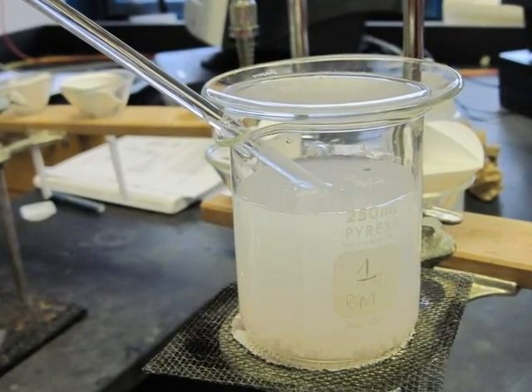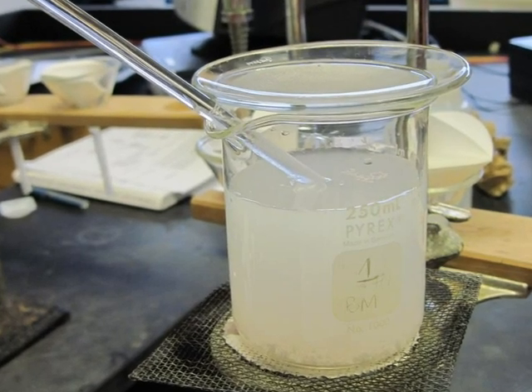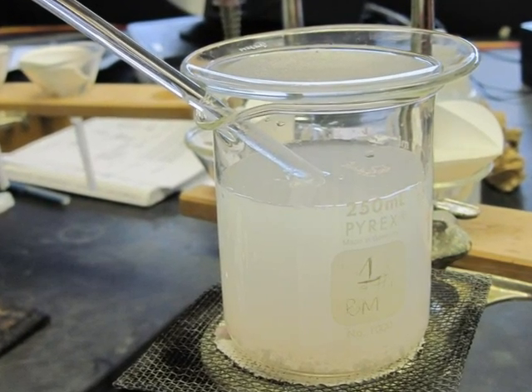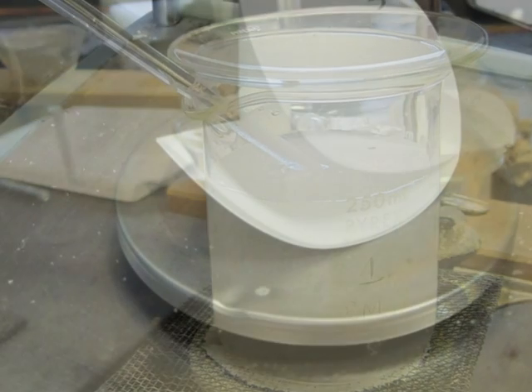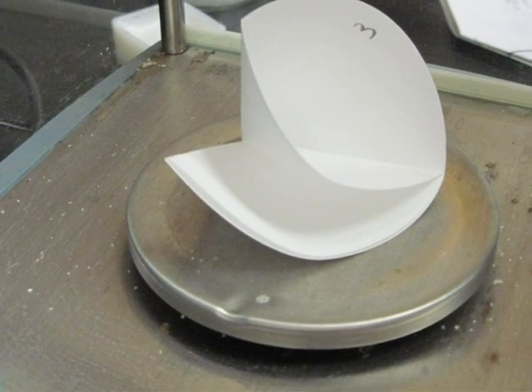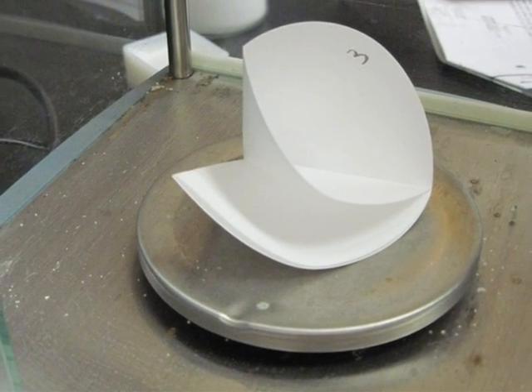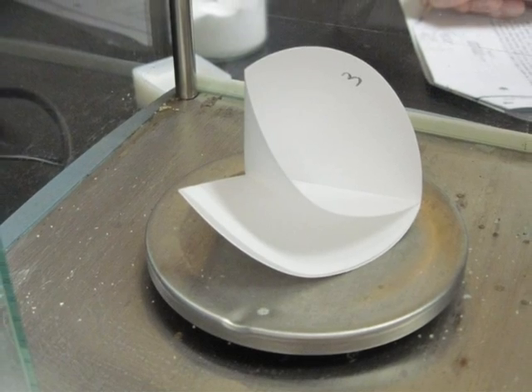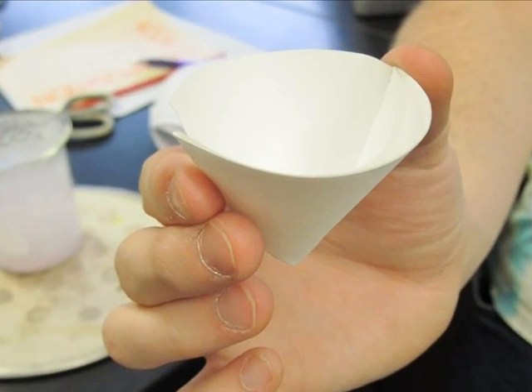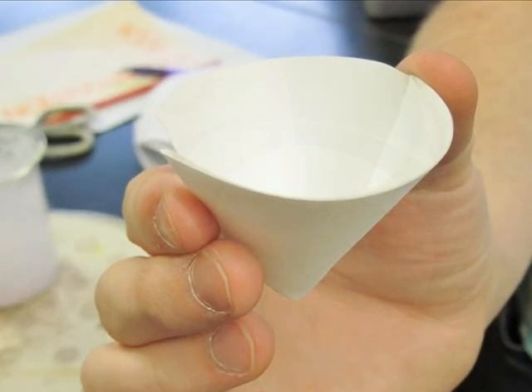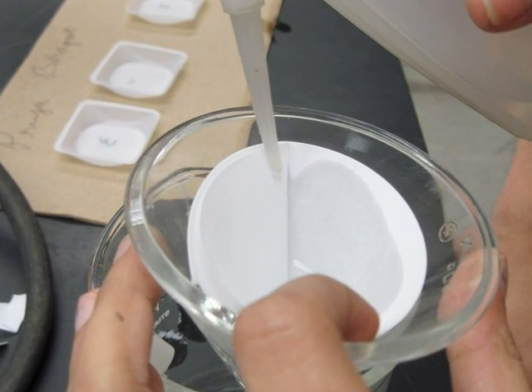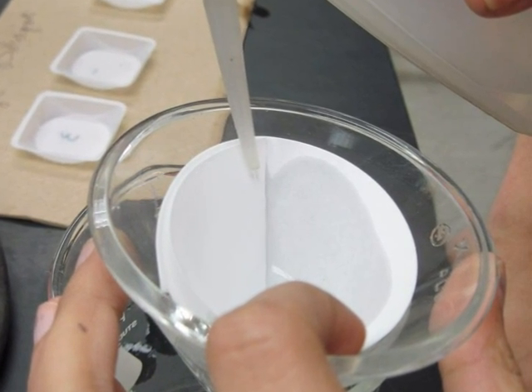Cover the beakers with a watch glass and warm each solution gently to ensure a complete reaction. You may wet the filter paper to hold it in place in the funnel.